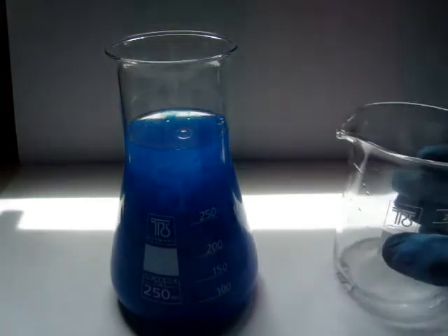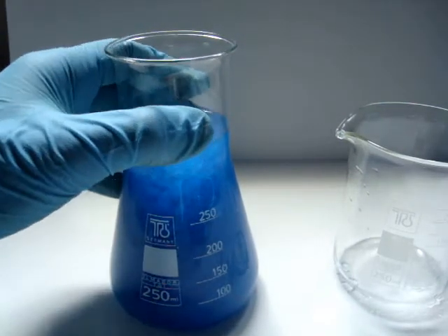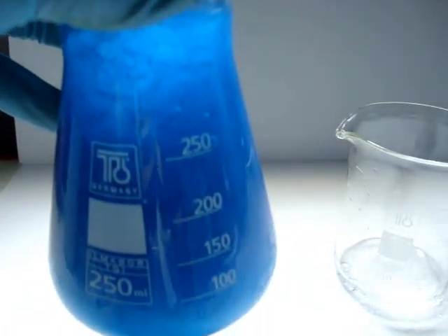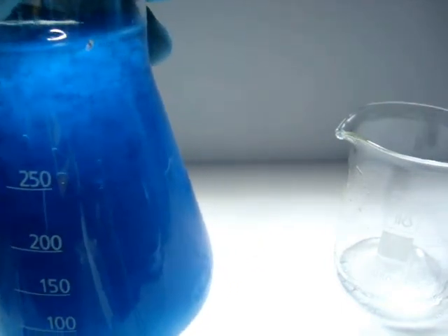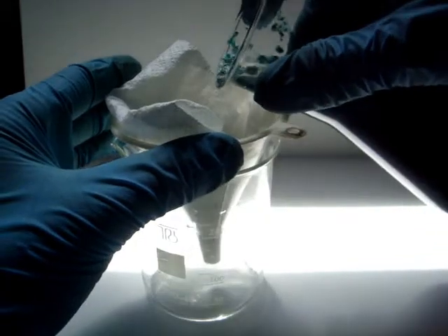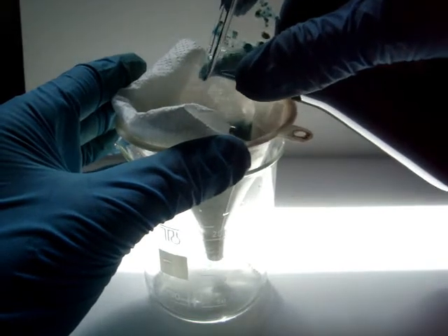Occasionally it is used as a ceramic colorant. If you want to separate the two compounds, it is necessary to filtrate the solution. Now you have copper hydroxide.